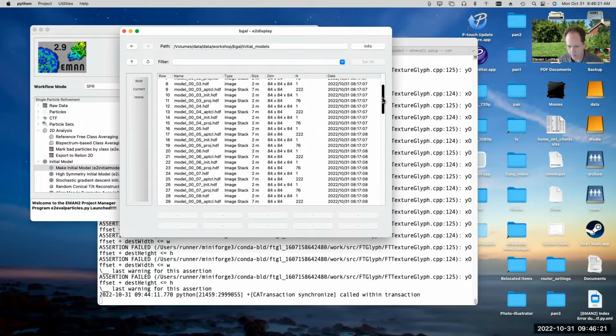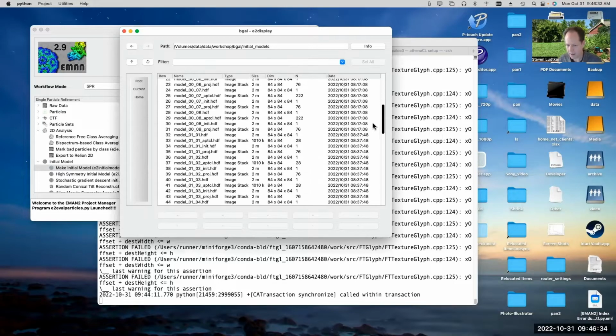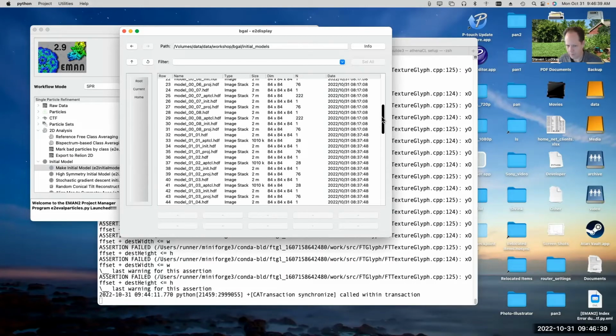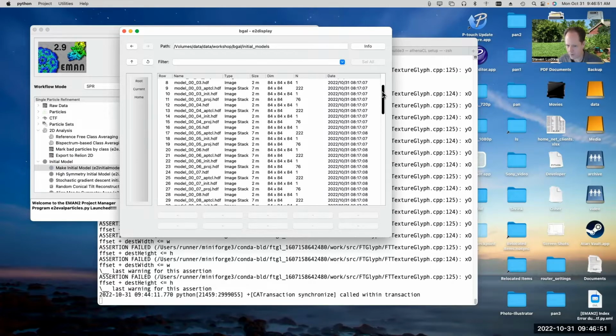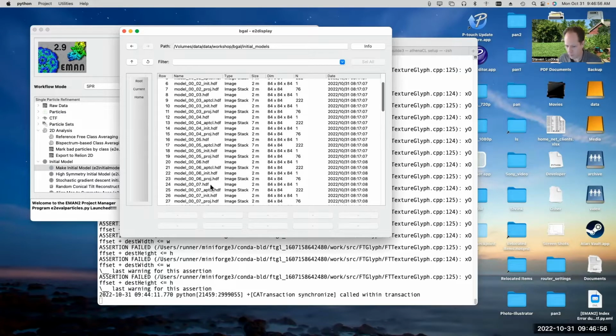So I ran this program 2 times. The first time I ran it, I used all of the class averages that came out of my second refinement run, the downsampled particles. And the second time I ran it, I used only the selected subset, the 17 that I decided were good. So what you see here, this model 0001, this is the first run of E2 initial model, and this is the first model that came out. When it generates initial models, it doesn't just generate one, it generates however many you asked for. And then in theory, it sorts them in order. So the best one should be first and the worst one should be last.